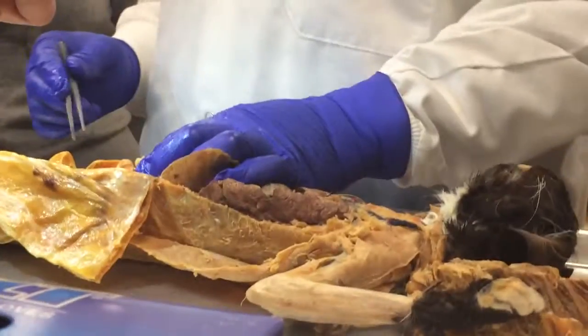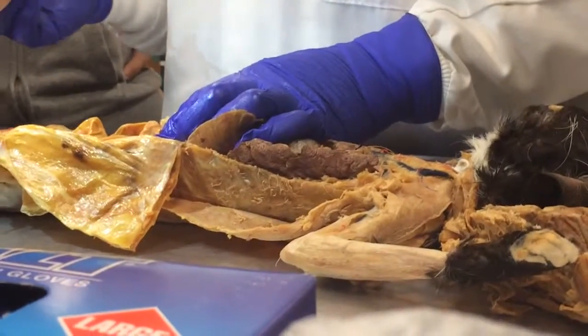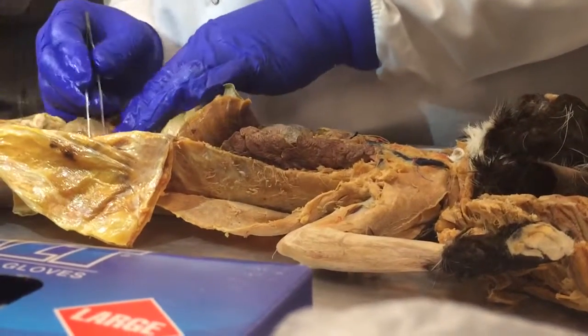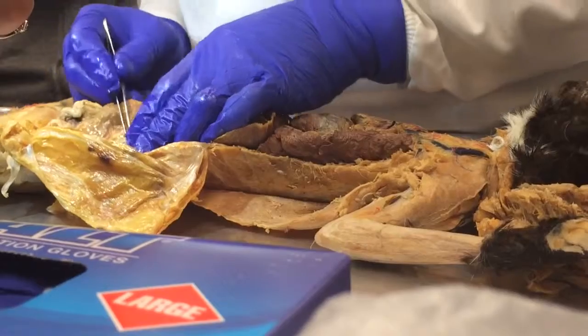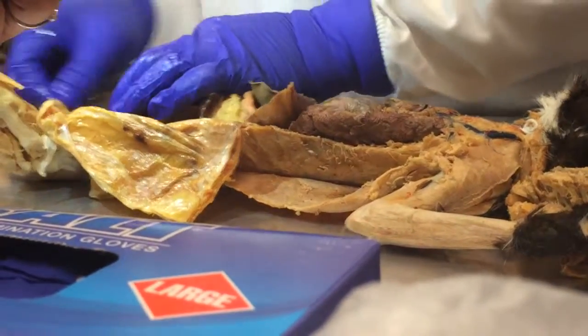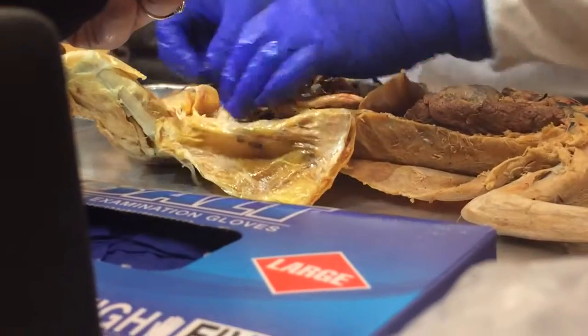I didn't see that on the list. The reason I put some of those things is because we would do a urinary system lab, and in the urinary system lab you'd then be doing just the kidneys, right, and the ureters, which you get to see. You see, these are the ureters going down there, okay, and then of course the bladder, which is here. Let me cut that. You see the bladder?